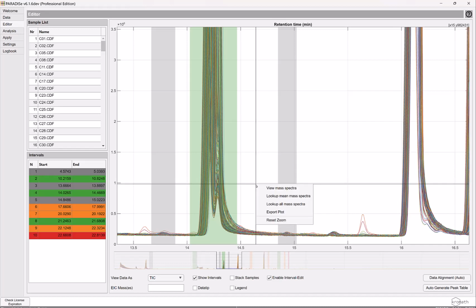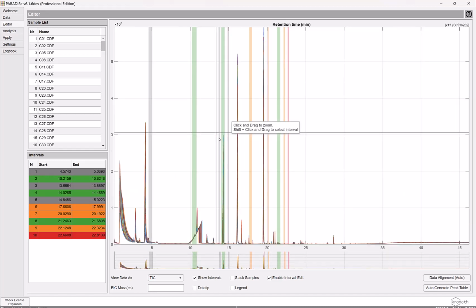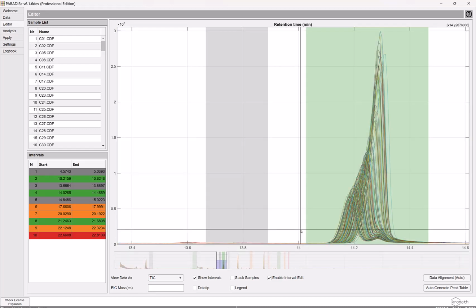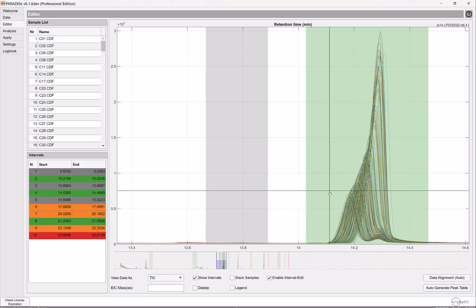Actually, let me zoom out again and just show you the peak here. Here we are. I don't know if you can see, but there's probably some overlap here, and it's completely within the other peak. So there's basically no resolution at all.